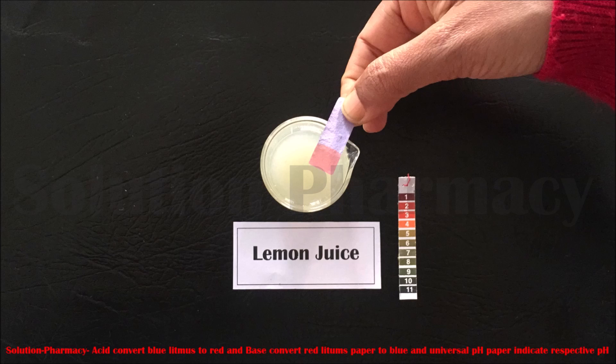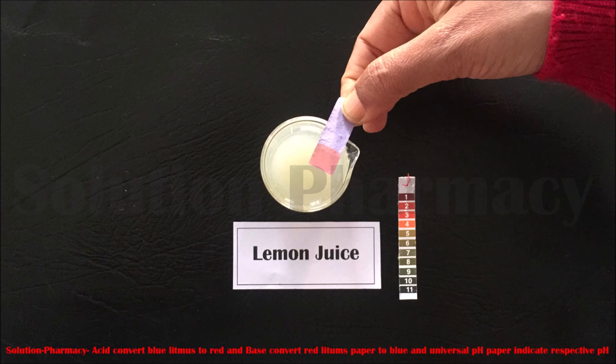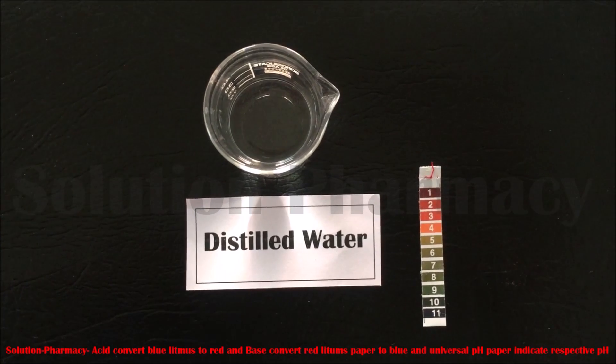pH means power of hydrogen, and it can be defined as the negative logarithm of hydrogen ion concentration in the solution. Now let's start the experiment.